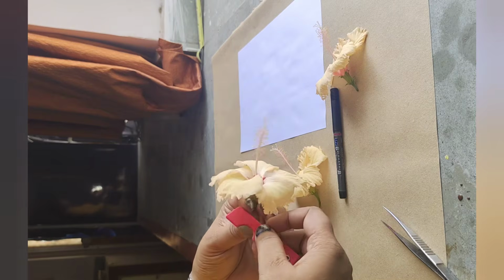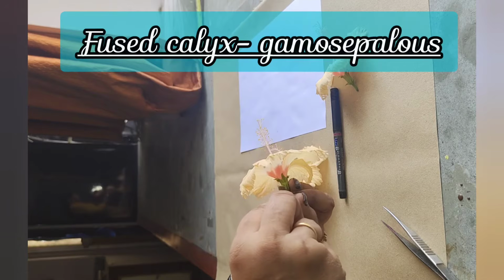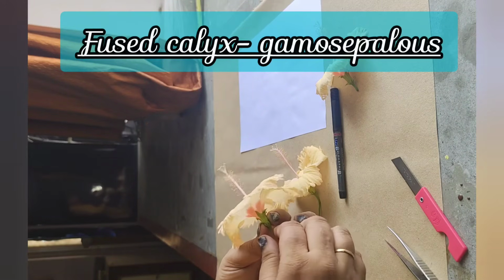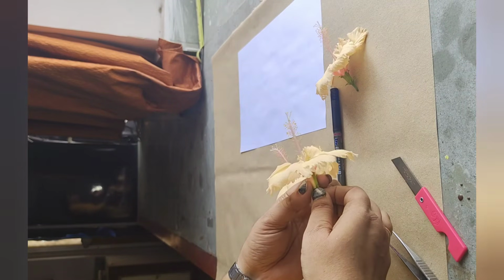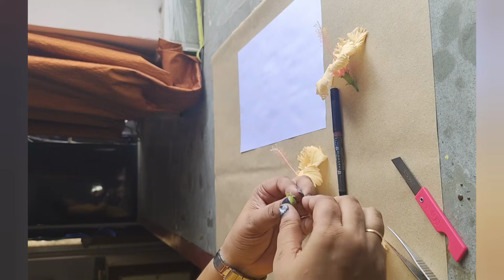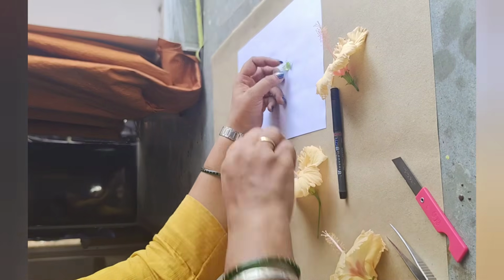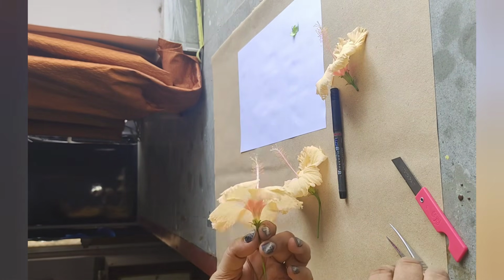So, for dissecting, we will need a blade, and with the help of the blade, we will make a small incision in the calyx, which is fused in the case of the hibiscus flower. The fused calyx is also known as gamosepalous, and carefully we will remove the sepals of this flower. Now the sepals are fused, and this forms the calyx of the flower. Let us keep the calyx on the paper.